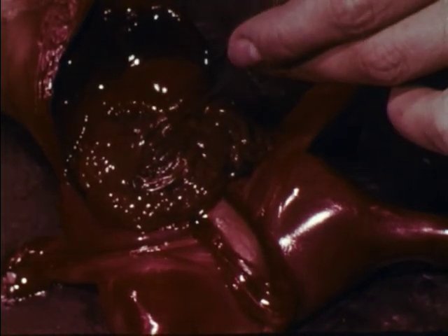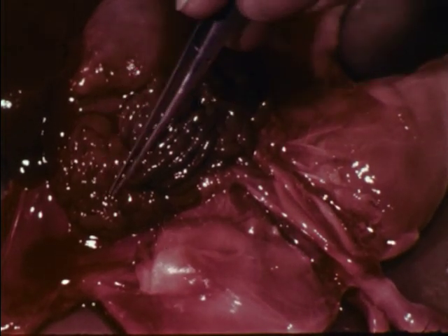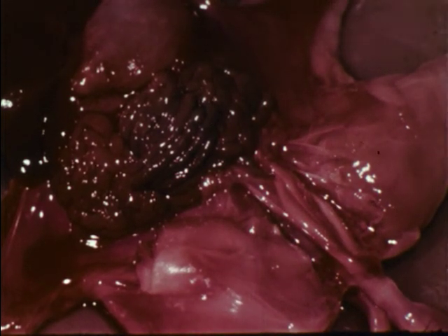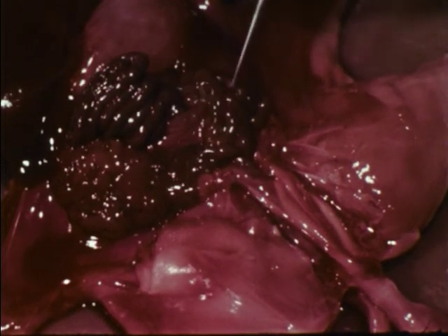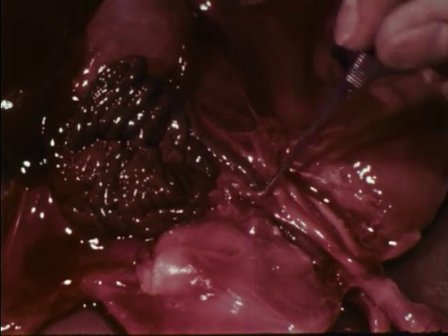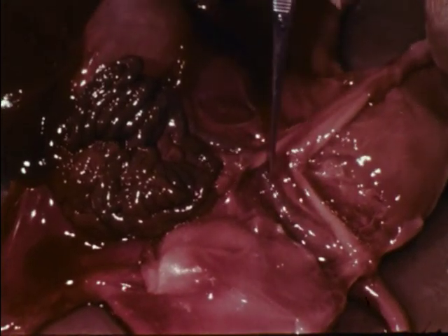The pancreas lies under the stomach and secretes several digestive enzymes, which pass into the duodenum. The long, small intestine also secretes enzymes and accounts for most digestion and absorption of the food. The undigested food enters the large intestine. Water is absorbed from the food as it passes through the large intestine. The waste material continues through the rectum and out the anus.